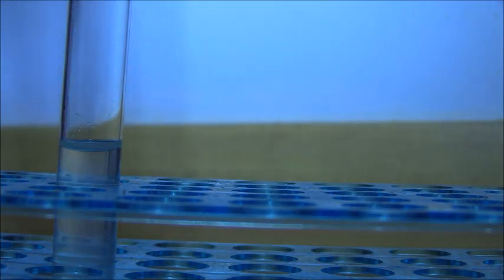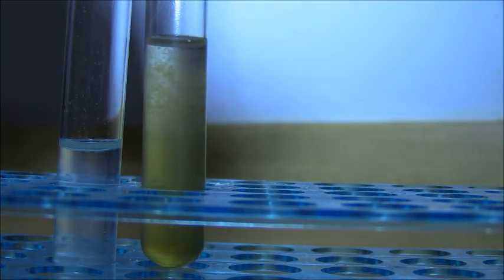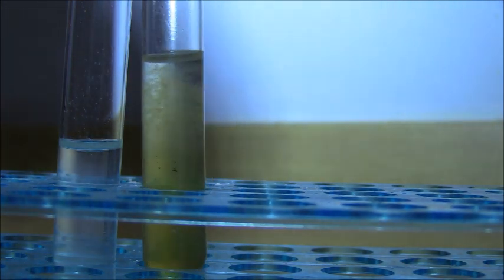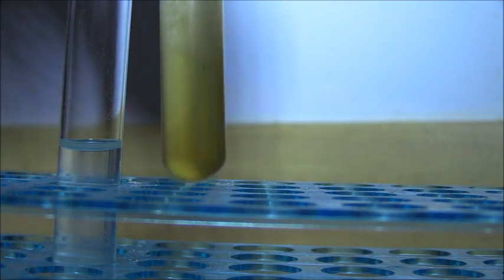So it's been about two minutes. And I put a little bit extra light on the situation here because it was kind of hard to see. I should have actually done that in the beginning. And actually you can see that we do in fact have a light brown precipitate, which is settling out. And zoom in there so you guys can see it. And there it is, the light brown precipitate.